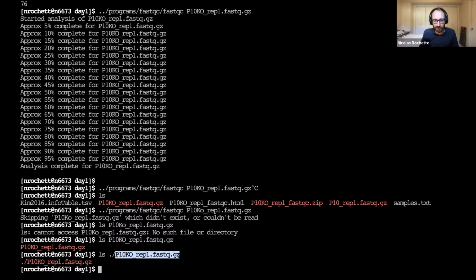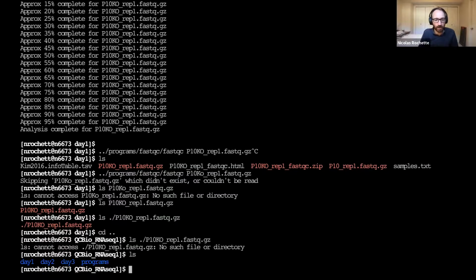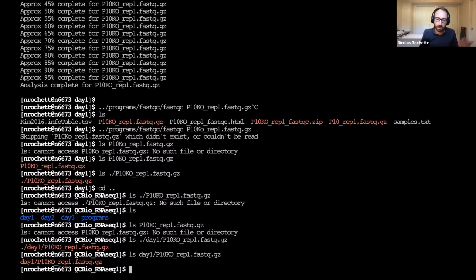So when in the Trimmomatic line you specified, let's say I'm not in the day one directory, then I can't do this. This is not going to work, right? Because this is a relative path and it's looking for this file in the current directory, and of course I'm in one directory above where I should be. So the file does not exist at the given path. And if I do this one without the ./ it's going to say the same thing. And really what it's asking for is for me to say, okay, I'm going to start from the current directory, then go into day one, and that's where the file is. And again, I don't need the ./ at the beginning. It's a bit more verbose. To have the ./ takes 2 more characters. It may help with comprehension, or maybe it's just bloating the command line, but they're both equivalent.